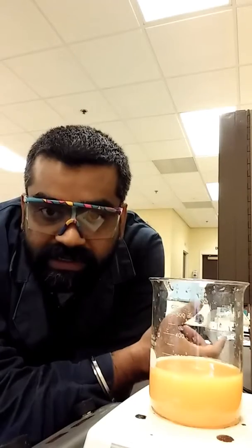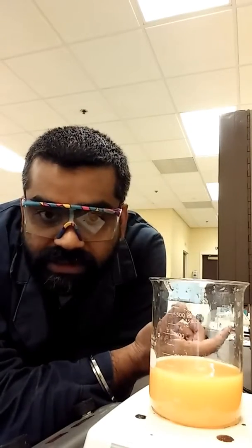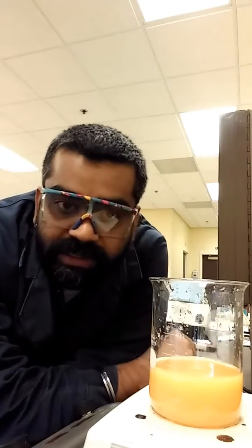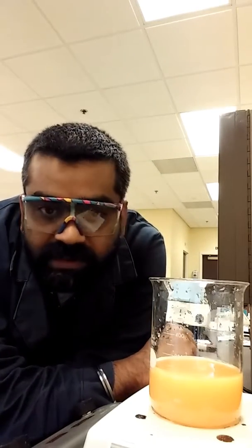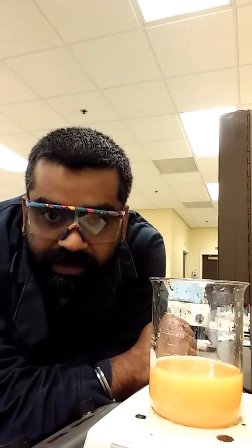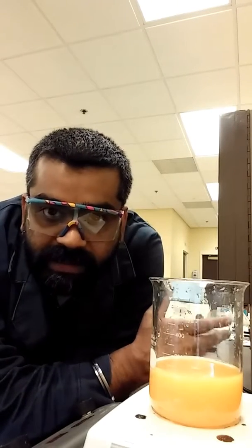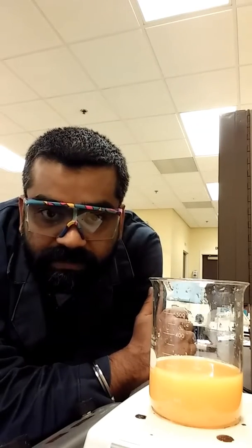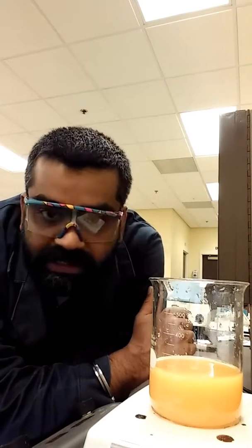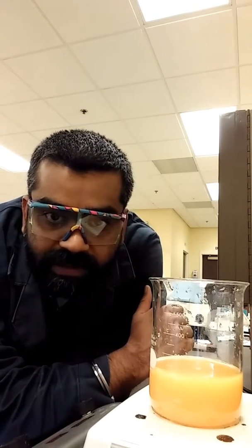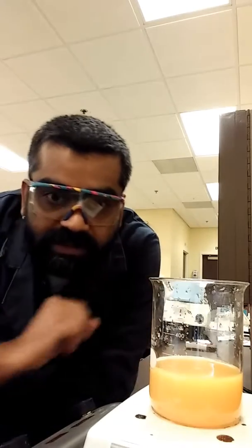And if it's still impure, recrystallize again. Now, you don't need to do distillation at this point because that's why we're doing this lab is to avoid distillation or reflux or any of those tedious work. So this is technically a one lab period work, but it may take a little longer, but it depends on your work ethics. So, well, that's it for step two. We're going to wait till this liquid comes to a boil and then we'll be back with step three of the process.